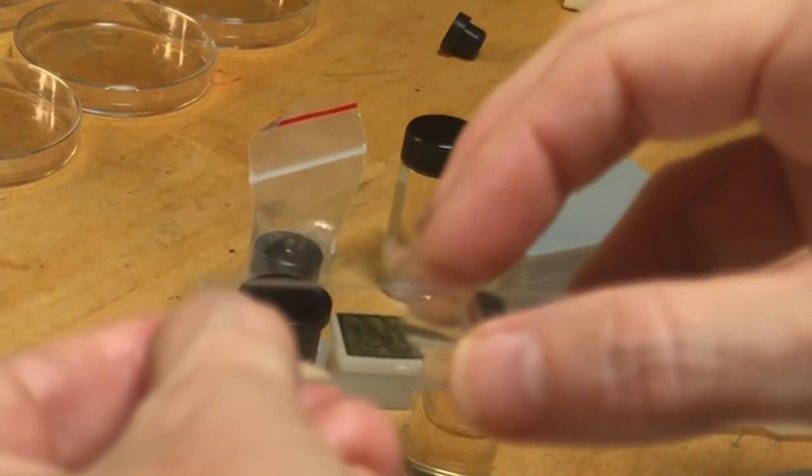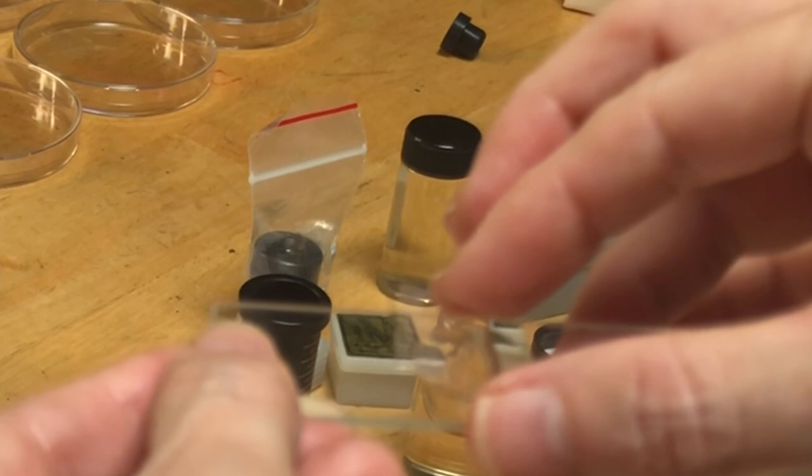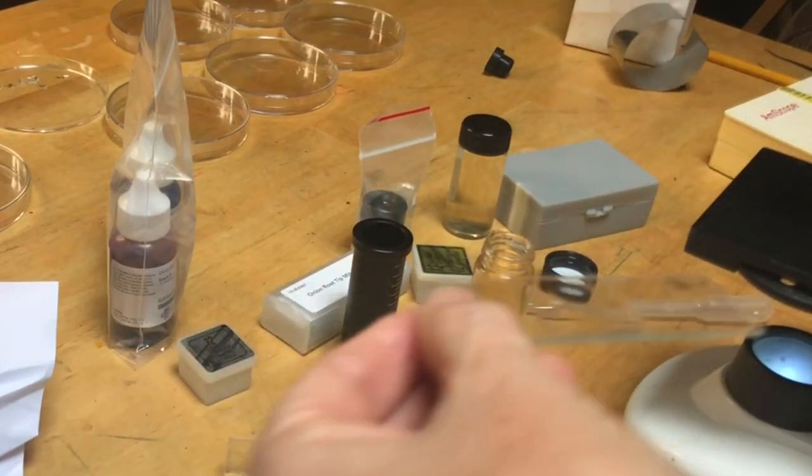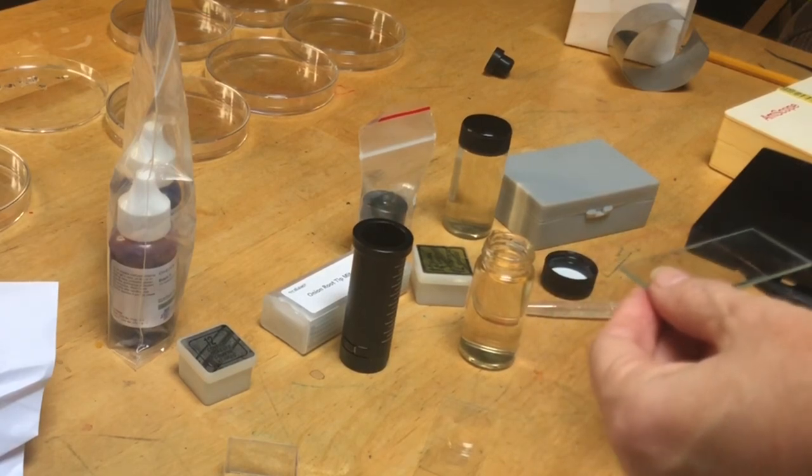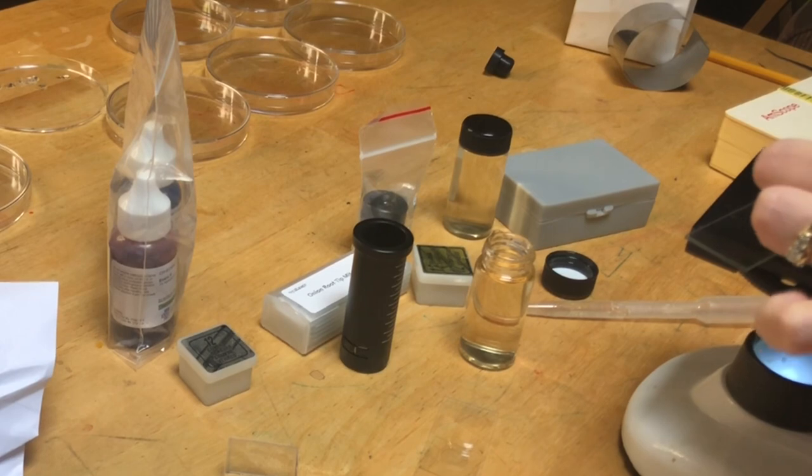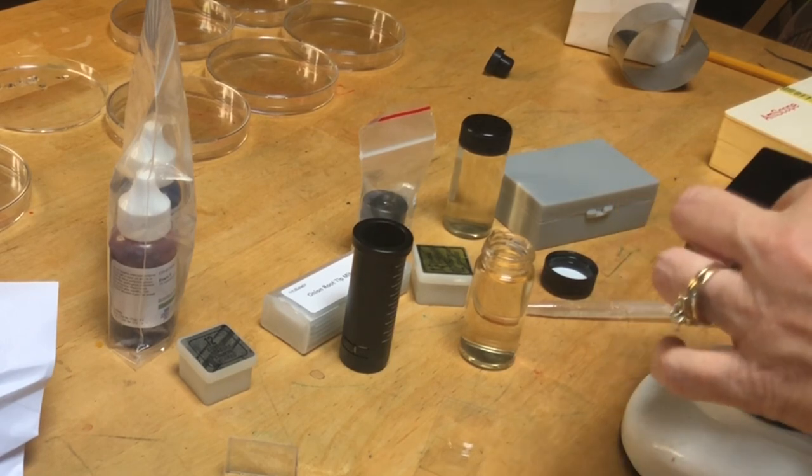So that edge is wet, and then drop it down. There, did well, so I don't have any bubbles in it. And then I'm going to switch to the lowest level magnification and put that under the microscope.